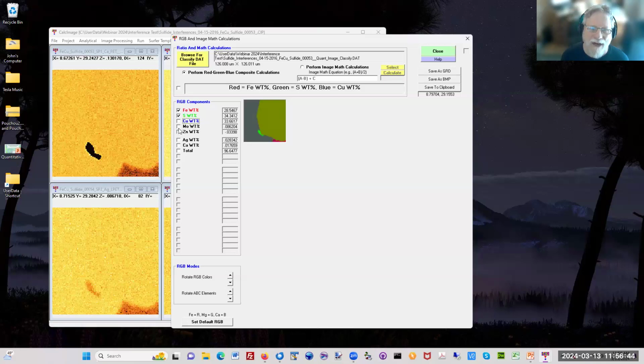You can say turn off copper and turn on molybdenum, and then you see a different map. And you can also do image math on the maps. This is where you calculate ratios of different maps. Basically each map is one of these variables here. So sulfur would be A, B would be the next element, and C would be the next element. So you can calculate your image math, or you can do RGB images. So yes, the answer is yes.